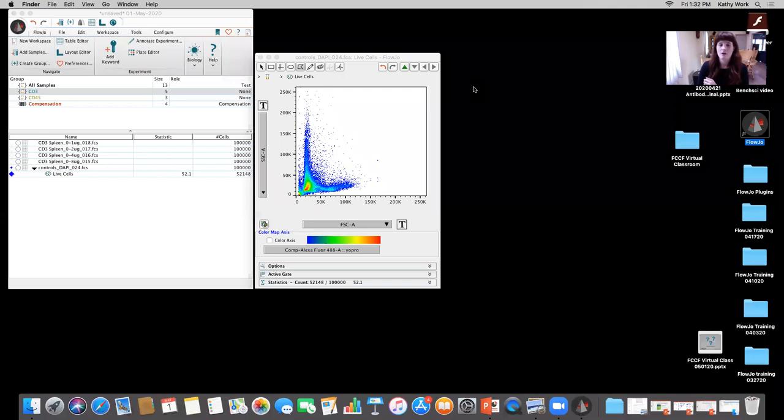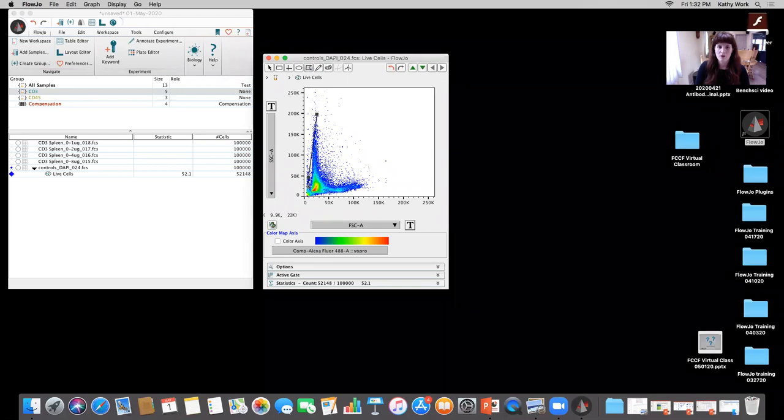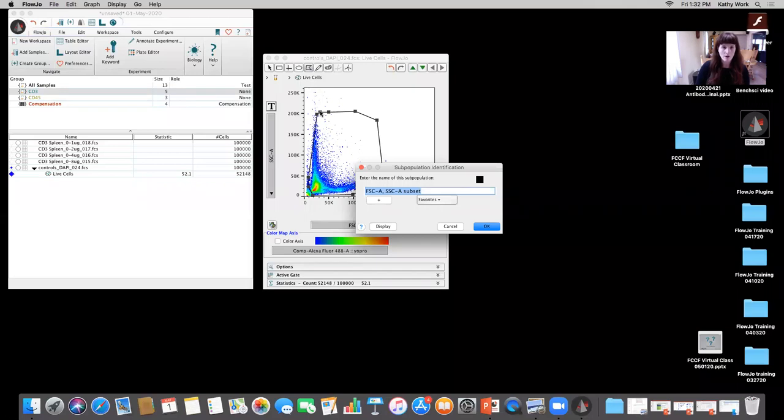Yes, absolutely. It's a very valid point. So I'm going through all this, and we've done some previous sessions really on the analysis, but we're trying to focus a little bit more today on, from an experimental standpoint, what can go wrong and how do we pick up on that? And we're getting the added benefit of utilizing FlowJo and learning FlowJo as we go along. So if I'm not sure and I have to go along an assumption that these are all my cells, if I don't have a vital marker, I can create a gate and call it scatter, right?